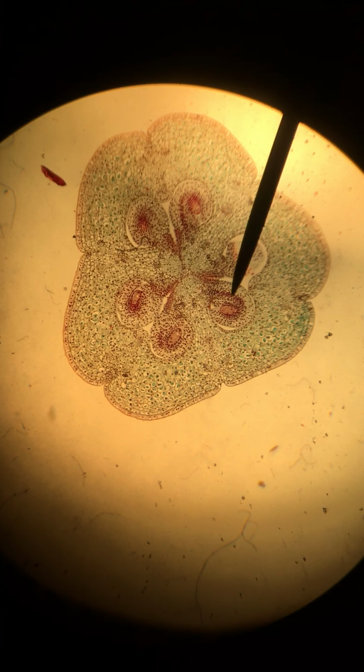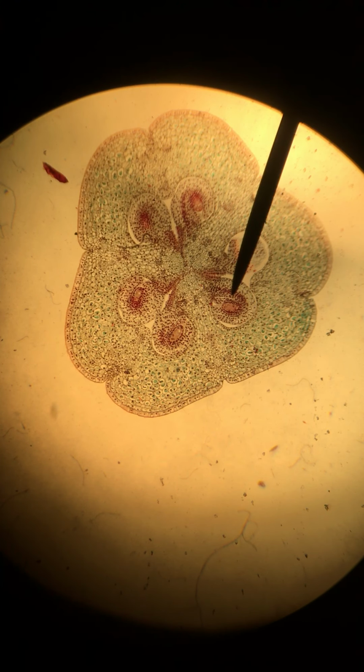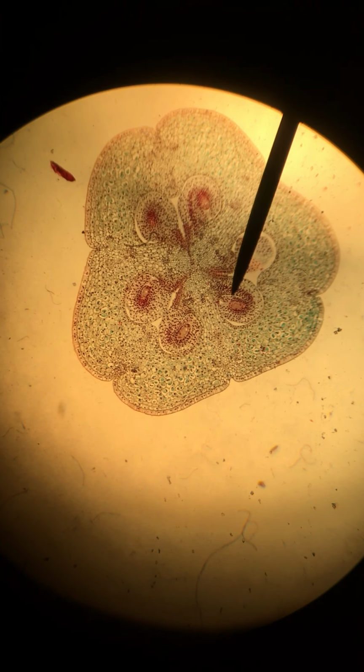So we're going to go back to this one. We are at the lowest magnification at this point, but you can see that surrounding the ovule there are these layers of cells that are called the integuments. These are layers of cells which surround the developing megasporocyte or megaspore, and they will ultimately produce a seed coat. The seed for a plant, an angiosperm, develops from the ovule. The outermost parts of that will form the seed coat. These are the layers of cells that are called the integuments here.